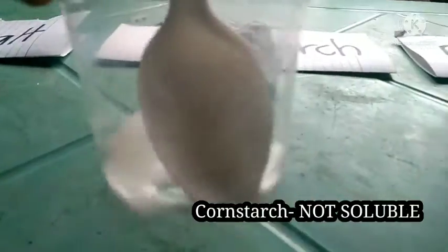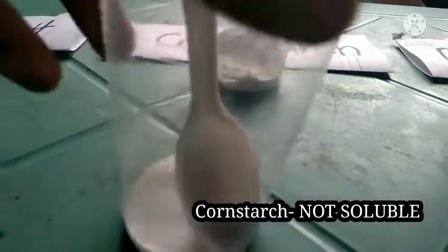Next is the cornstarch or the polymer of glucose. As you can see, it is cloudy. So, it is not totally dissolved in water. So, we can say that cornstarch is not soluble in water.